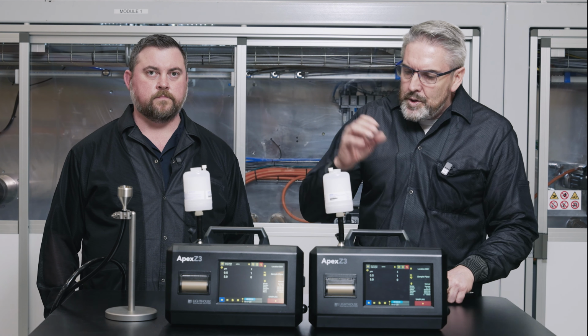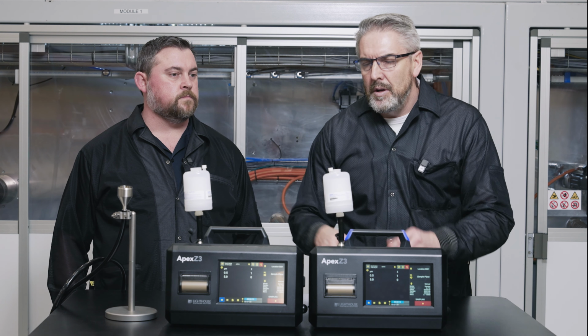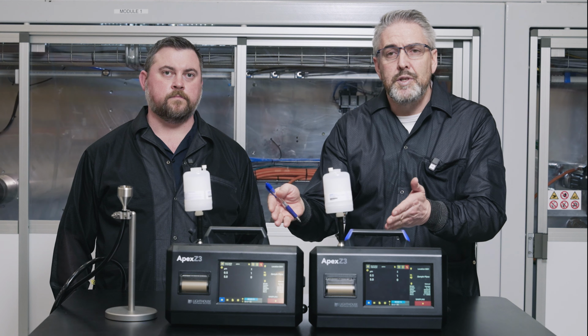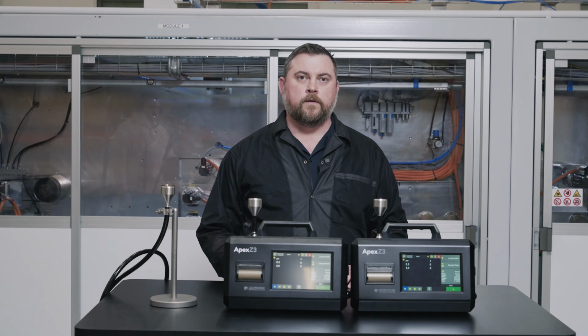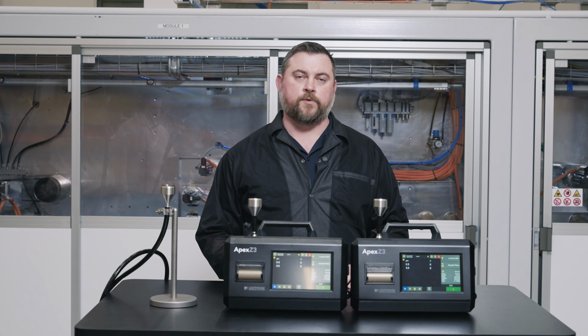So once we have the sensors cleaned up, we're going to get into method 1, where we're going to validate the differences in counting between the two instruments before we actually get into sampling the system setup. So the first step in our test is to choose a test environment. Now you can use the clean room where your particle counters and tubing is going to be installed permanently.